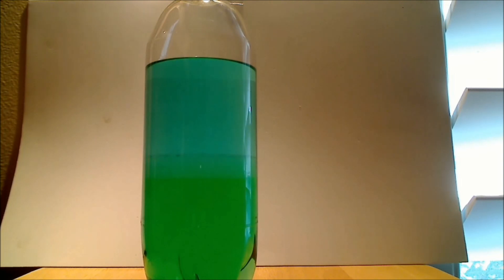Let's give it enough time to completely separate. And it's pretty clear now that we have two phases. And as I said, the top phase is mostly isopropyl alcohol, a little bit of salt, a little bit of water. Whereas the bottom phase is mostly salt water.